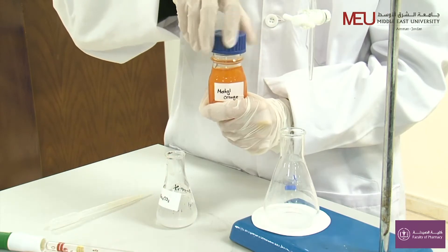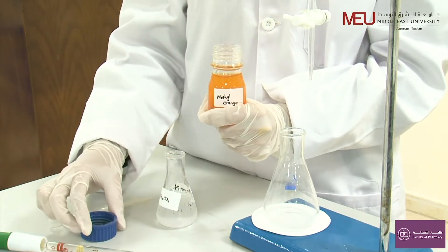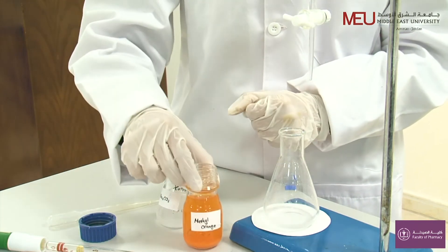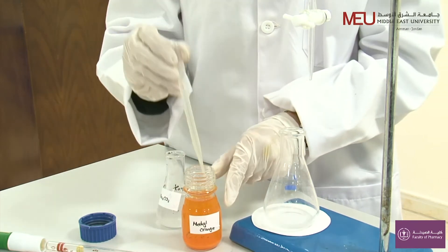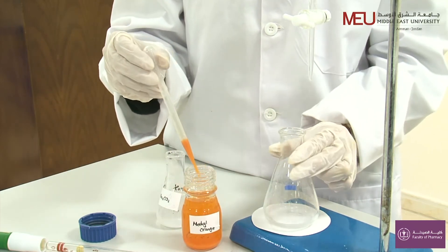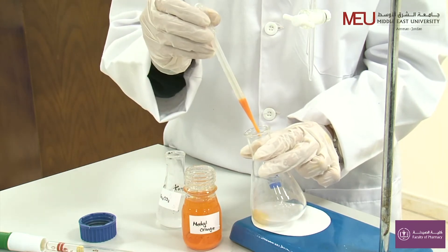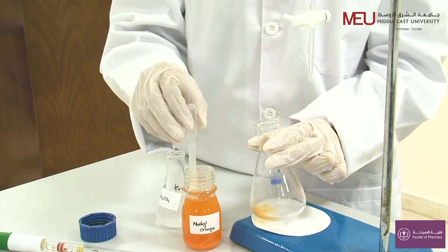In order to reach the colored endpoint, we will use an acid-base indicator. And in this case, I will use methyl orange indicator, which is yellow in basic medium. And once the medium turns to acidic medium, it will turn to pink-red.